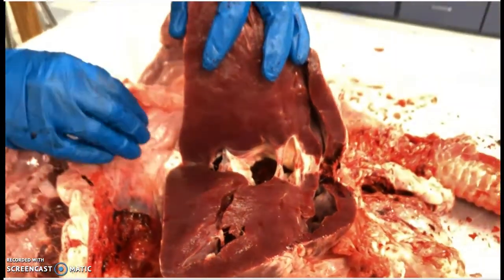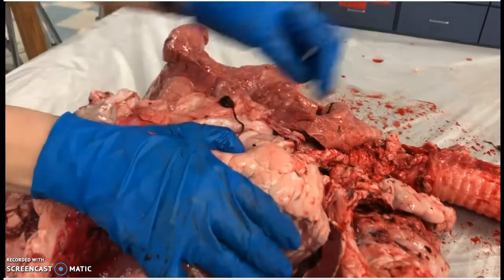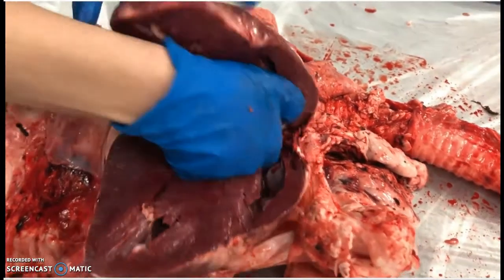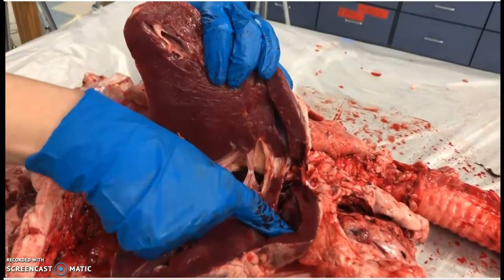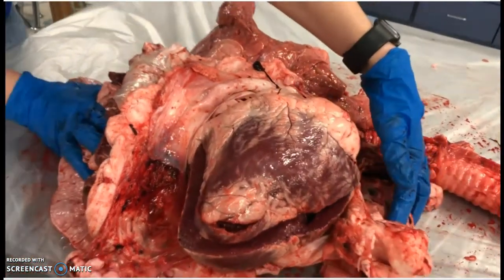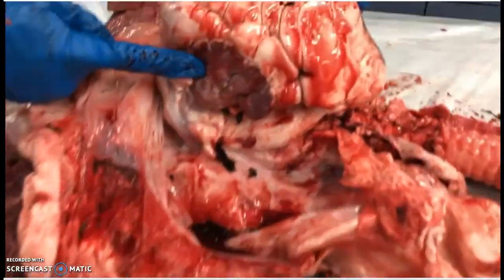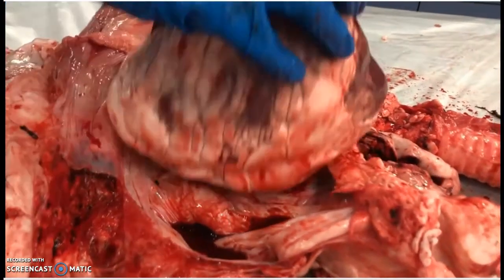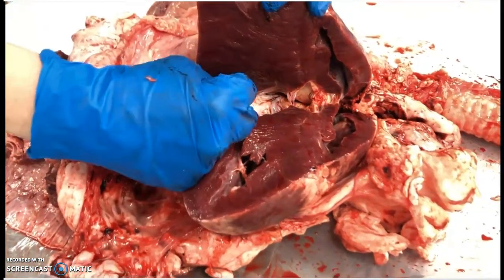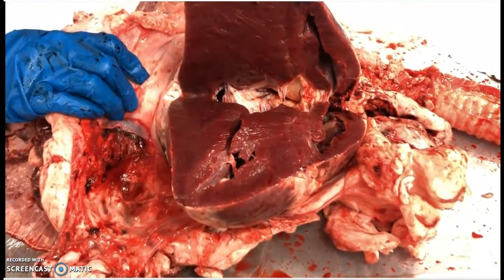Why is one ventricle so much larger than the other? As you're learning about the pathway of blood through the heart: blood comes in through the right atrium from the body, goes to the right ventricle, then the right ventricle squeezes, contracts, and sends blood to the lungs — which are right here, close by. Then it comes back from the lungs into the left atrium. Left atrium squeezes, pushes it into the left ventricle. When the left ventricle contracts, it pushes blood through the whole body. So much more muscle, thicker muscle, because it has to push blood a much farther distance.